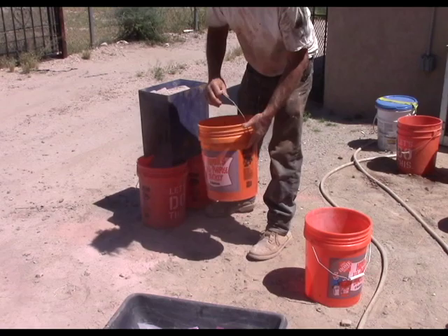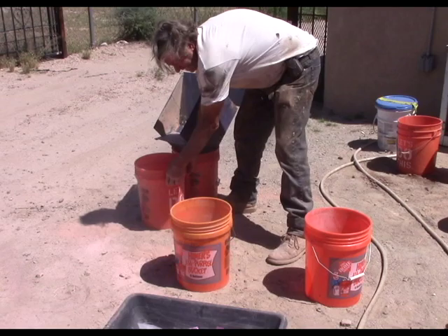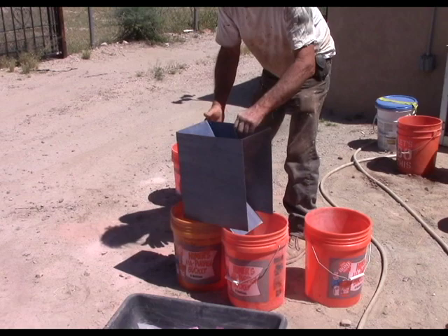That puts the original bucket over here. Now this bucket goes back in — this now becomes our central splitting bucket. It's already marked with the original sample number.